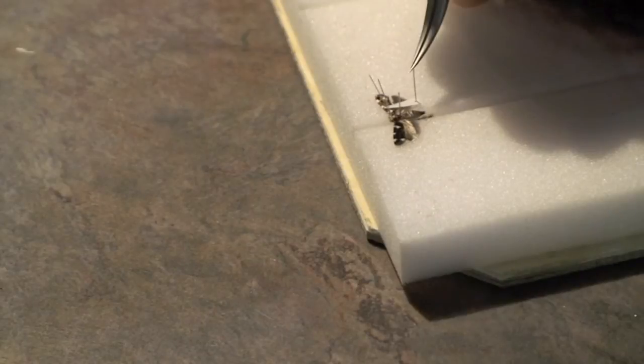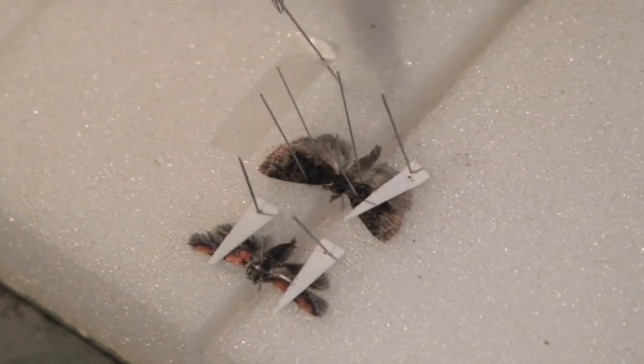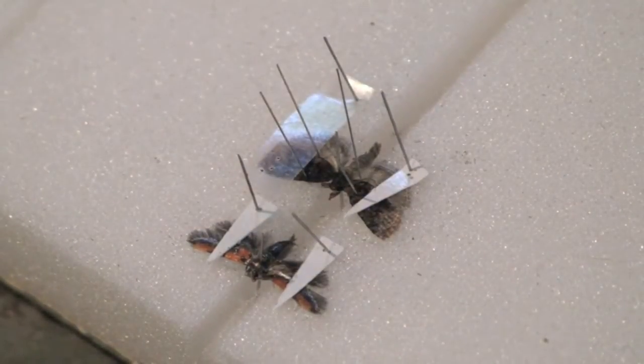Minutins placed through points punched out of label paper can be used to hold the wings in place, or alternatively, a strip of tracing paper can be used.